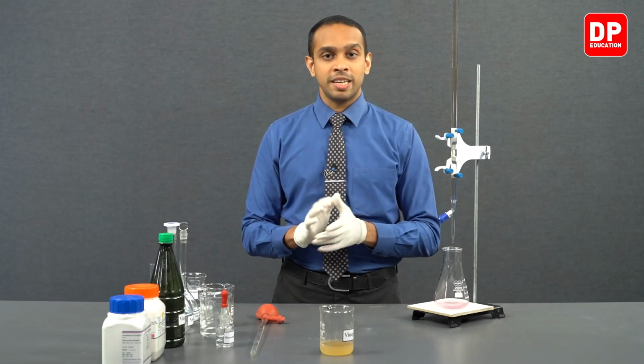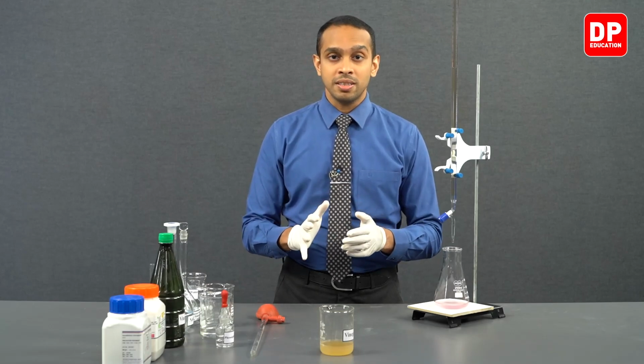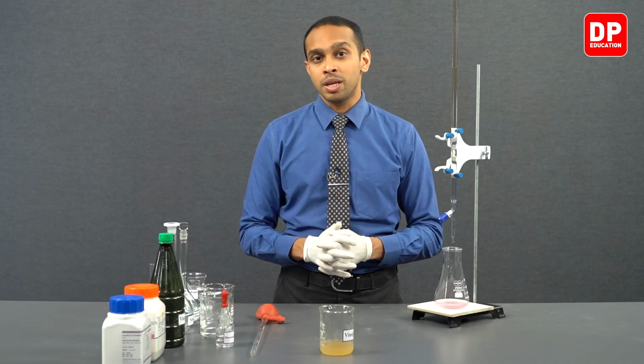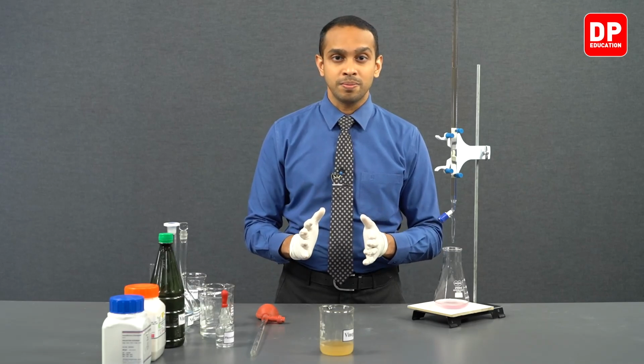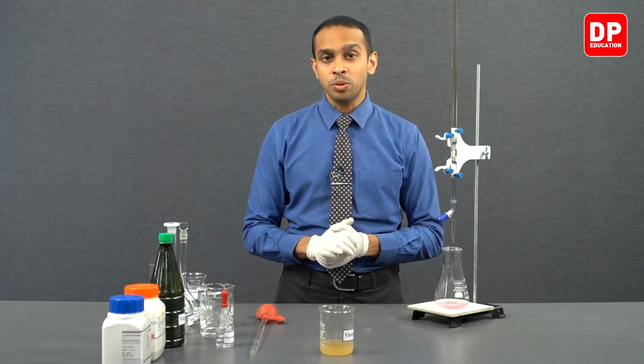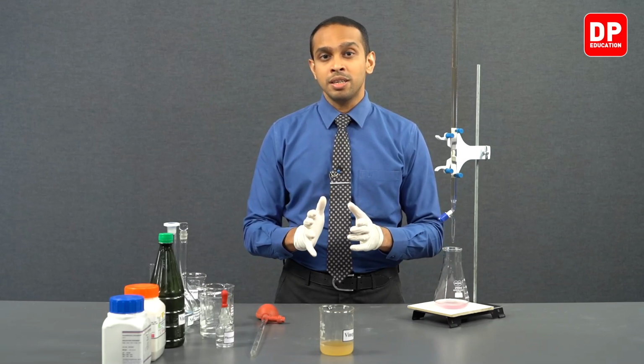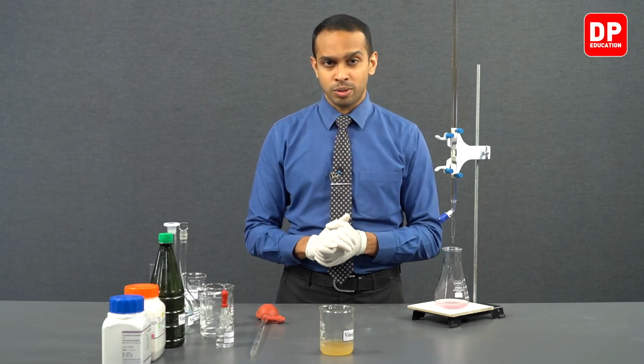So students, in this experiment, we learned that sodium hydroxide cannot be used as a primary standard. So what did we do? We used a primary standard to standardize sodium hydroxide. Sodium hydroxide was standardized by a solution of potassium hydrogen phthalate.